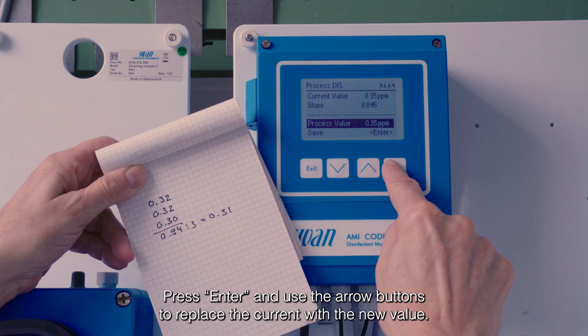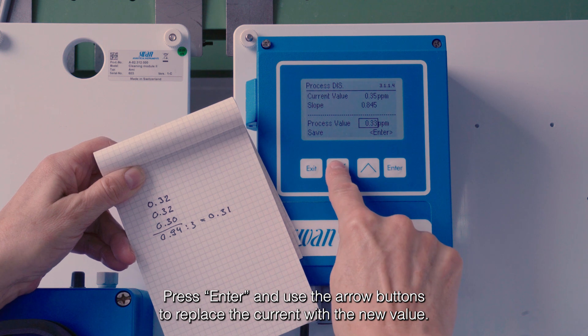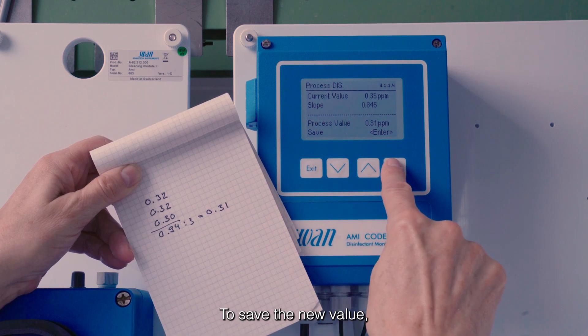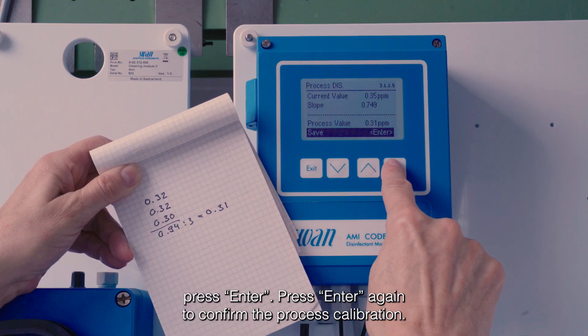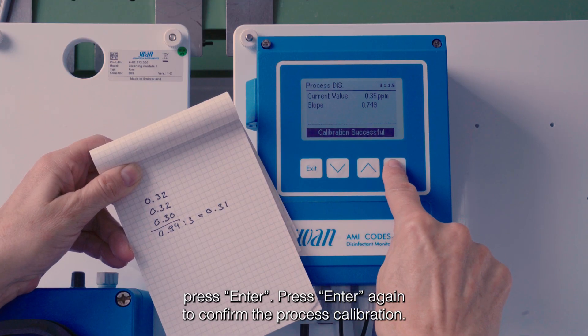Press Enter and use the arrow buttons to replace the current value with the new value. To save the new value, press Enter. Press Enter again to confirm the process calibration.